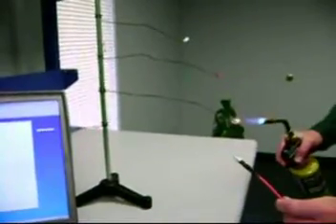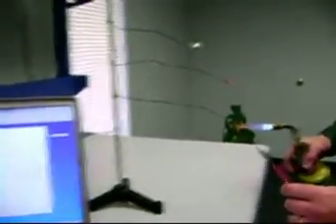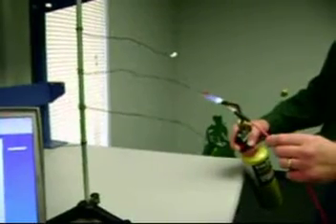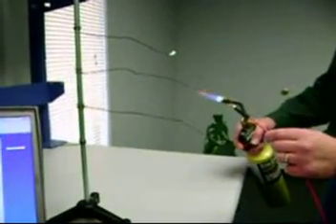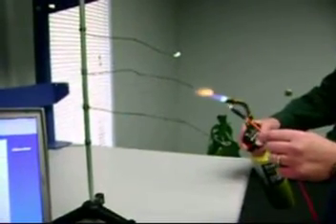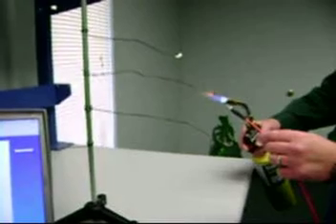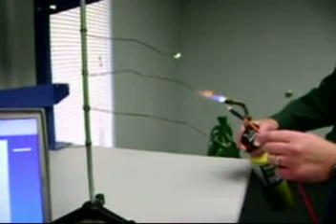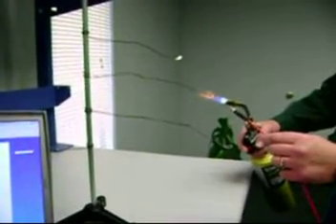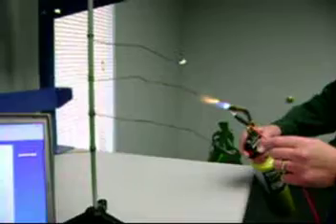We're looking at powdered vitamins in two cases, specifically iron lines. You can see that we're simply applying the flame to the powdered solutions on a flame loop and looking at the colored emission lines.